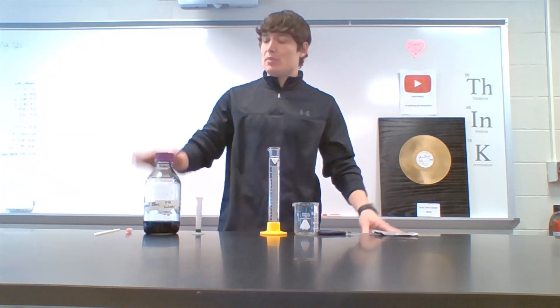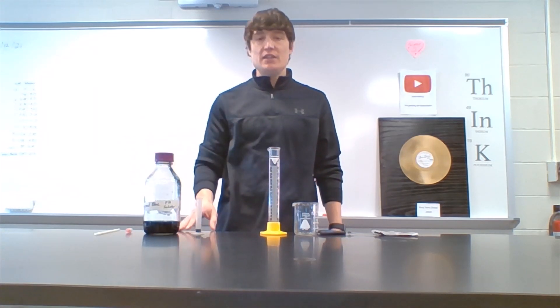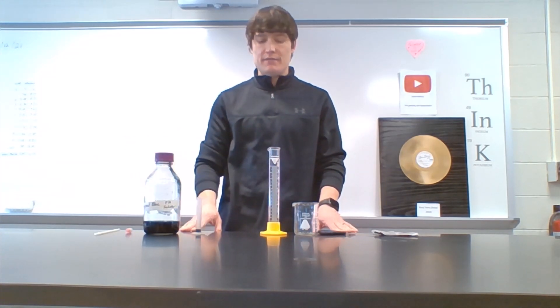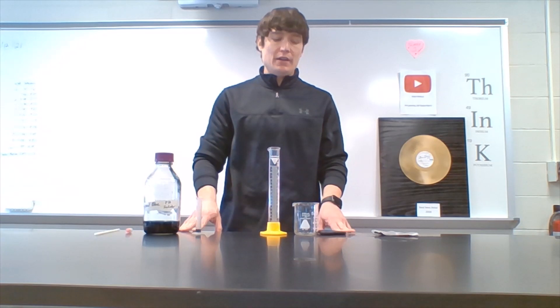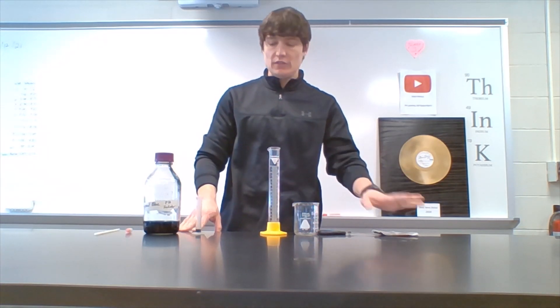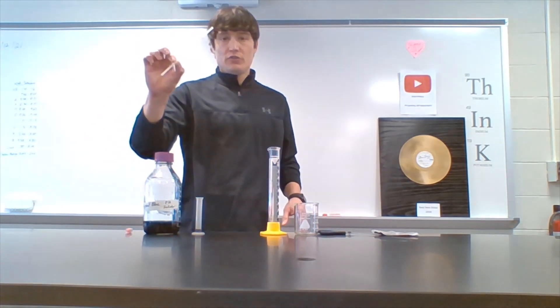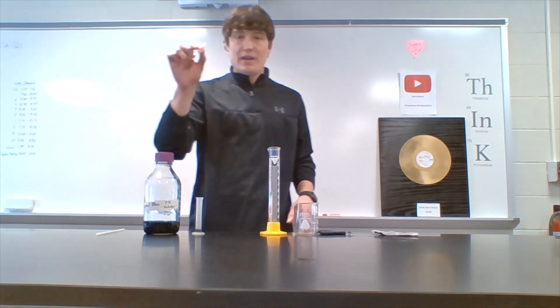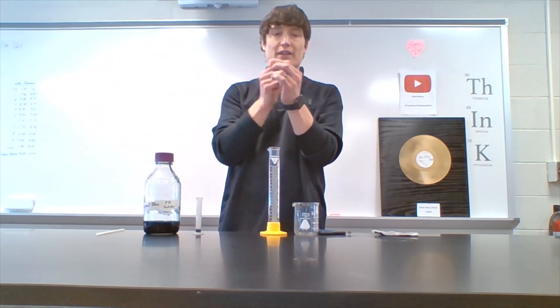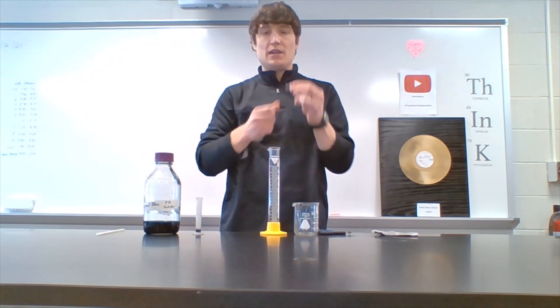Here's what you're gonna need: bromothymol blue, which is a pH indicator — you need about 5 ml of that — 115 ml water, a small beaker, scissors, aluminum foil, a regular old drinking straw, and a one-way valve where air can pass through one side but not back through the other.